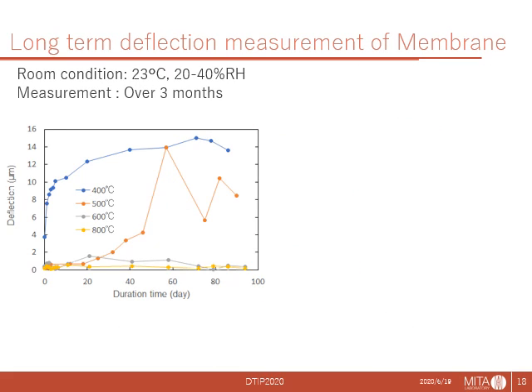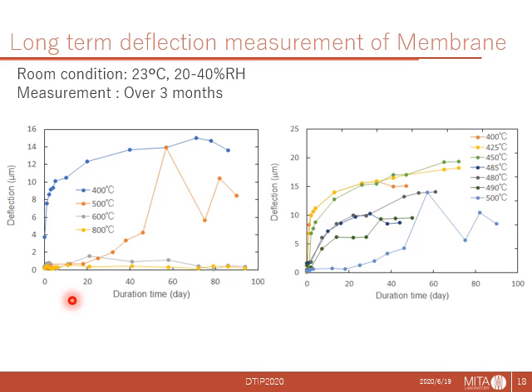This graph shows the maximum deflection depth changes according to annealing temperature. For the first 20 days, the 500 centigrade annealed membrane seemed to be flat. So we considered around 500 as a critical temperature and fabricated 6 additional chips with various annealing temperatures between 400 and 500. The measurement told that the sample annealed at 450 wrinkled in a couple of days. The samples between 450 and 500 also wrinkled but with slower change, and 500 also began to deform after 1 month.